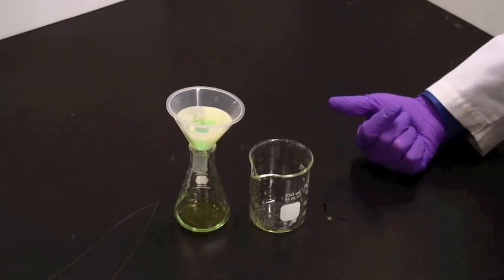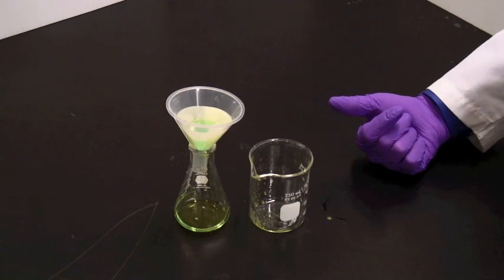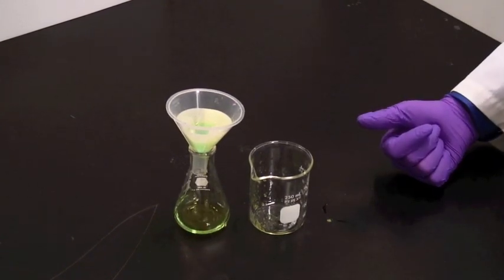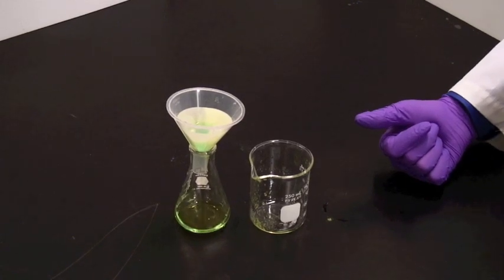Now, in this case, I'm actually interested in the solid. Sometimes you're only interested in the liquid, in which case, just passing it through once as long as there's no solid left is all you need to do.